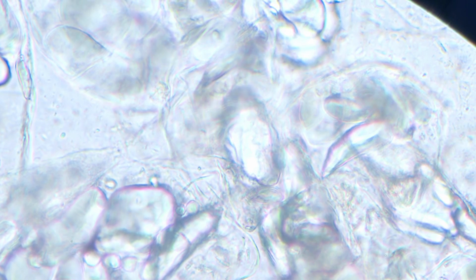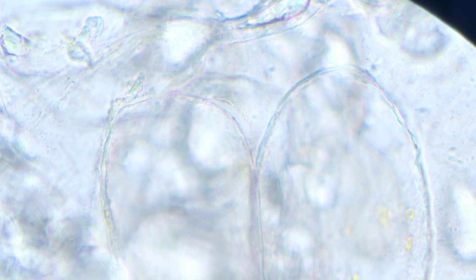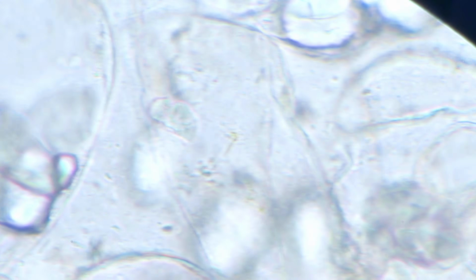Every other organism out there would want to feed on it, especially if there is sugar. But most of the time you'll find that those parts are just fermenting and not really rotting away. So you might not find any organism there, but there are chances that you might find them. And especially fruits which are succulent. We have mangoes, we have bananas.